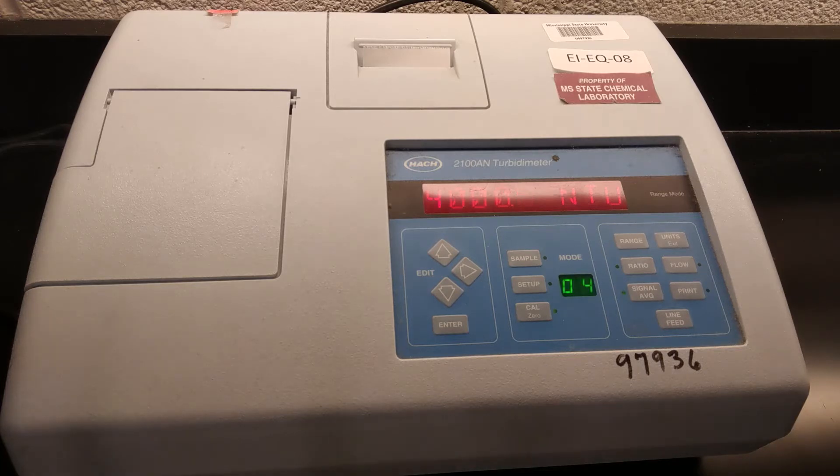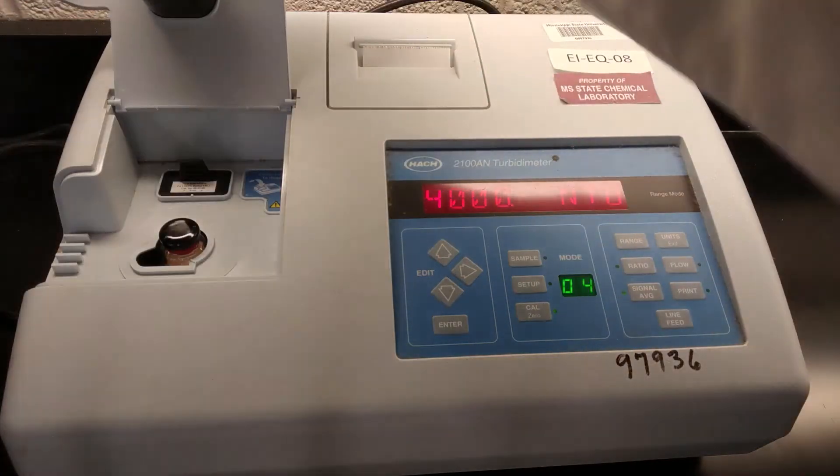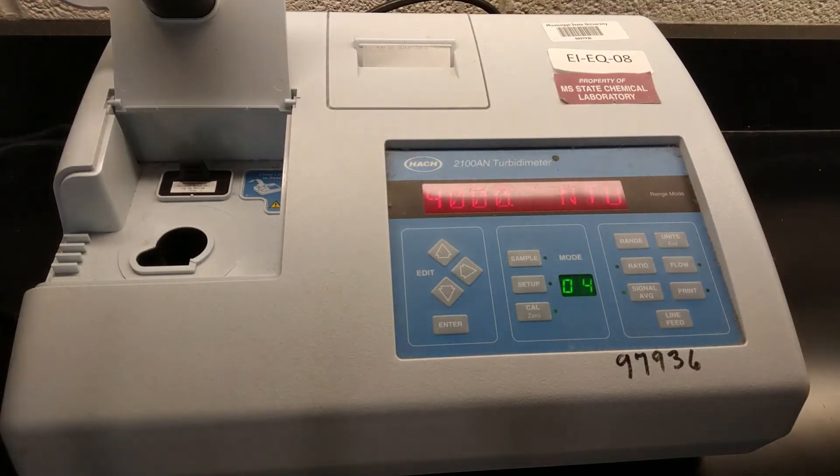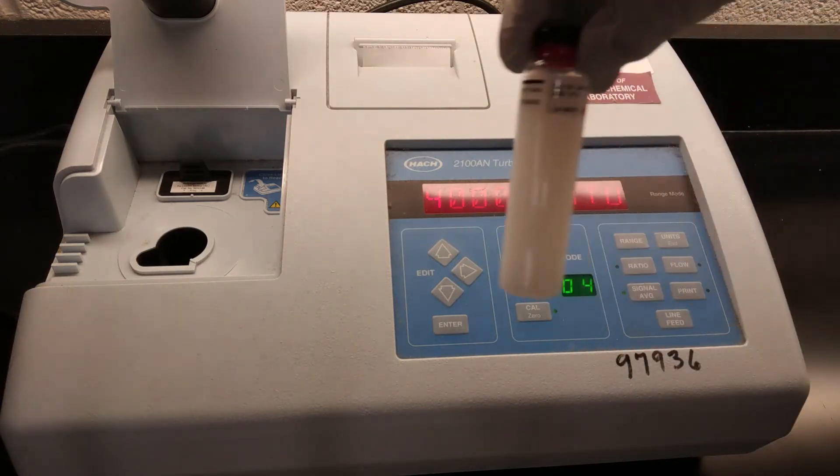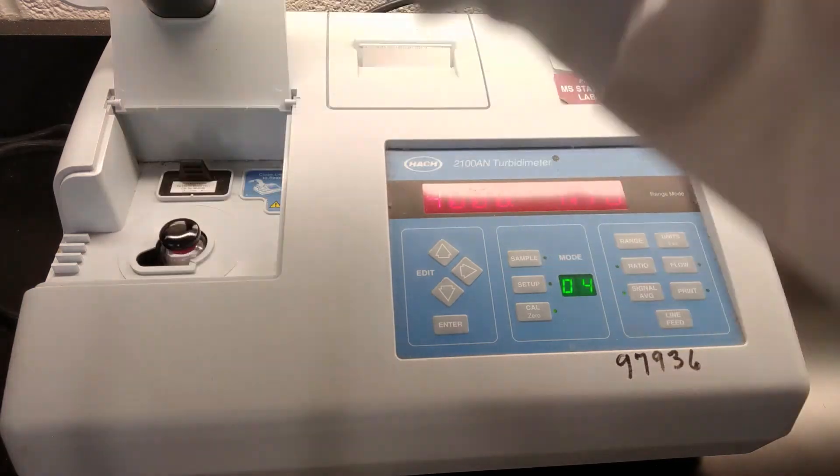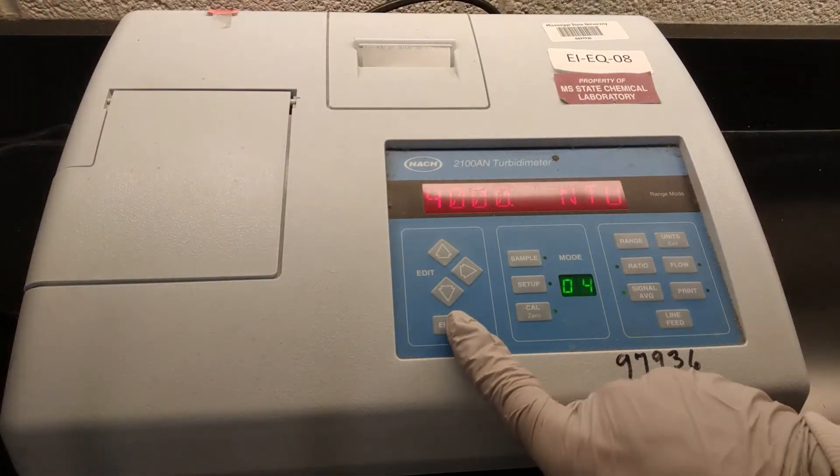All right, our 1000 is done. Pull that out. Put this next one in, a couple of inversions, make sure it's well mixed. This is our 4000 NTU standard. There we go.